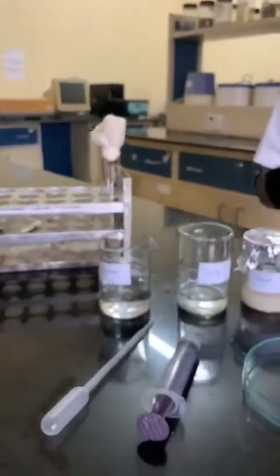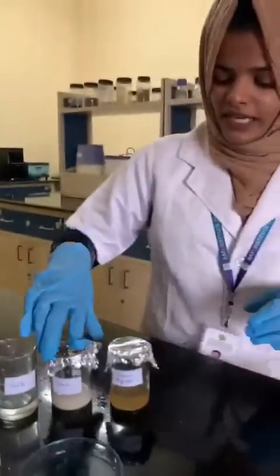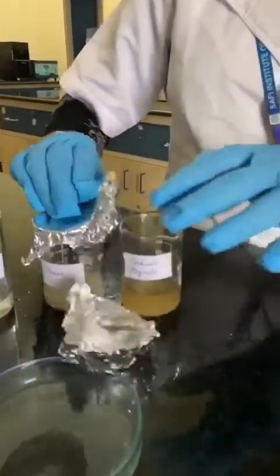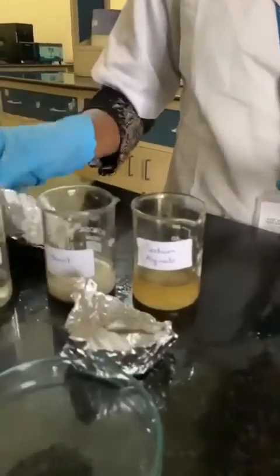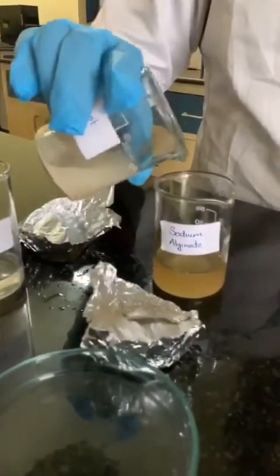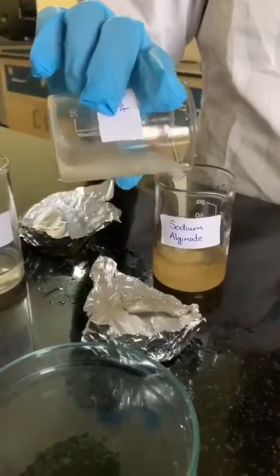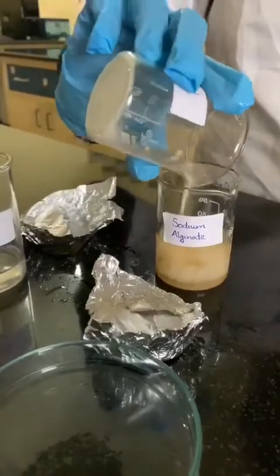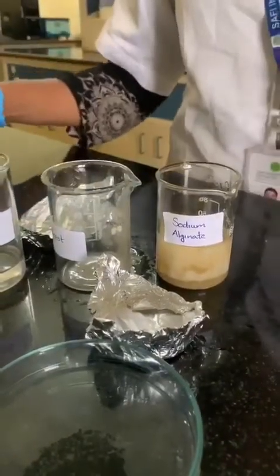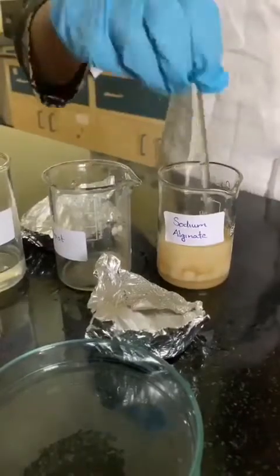So, let's start with the procedure. First step: take 25 ml of yeast solution and 25 ml of sodium alginate in the ratio 1 to 1, and mix it with a glass rod.